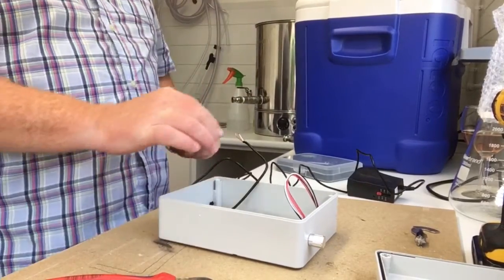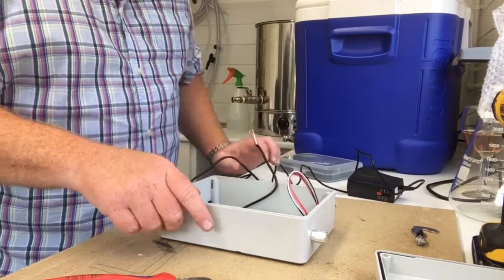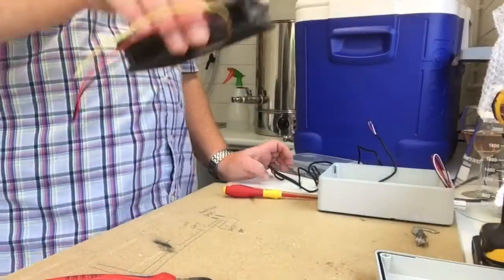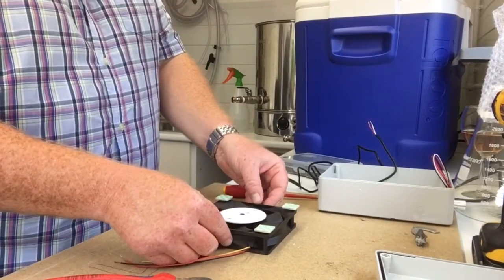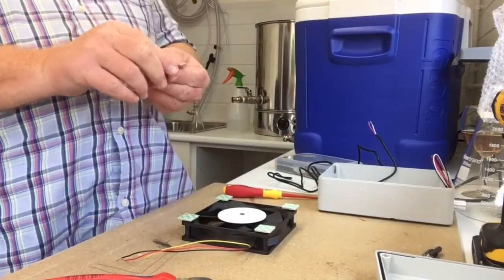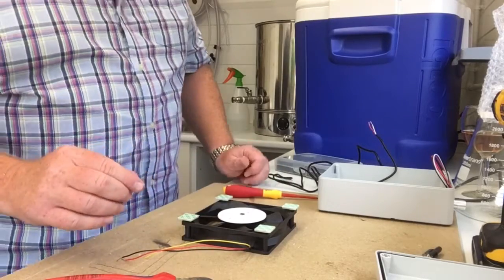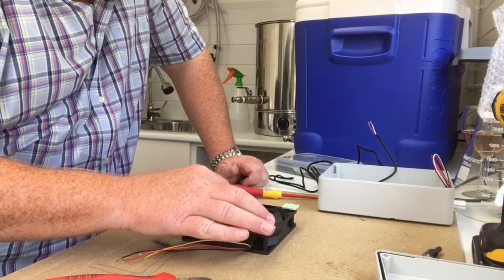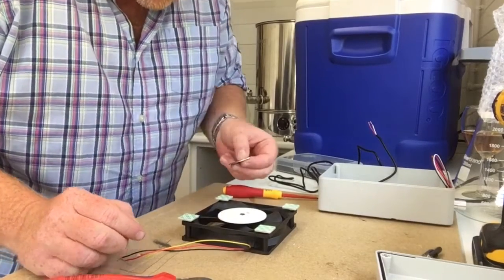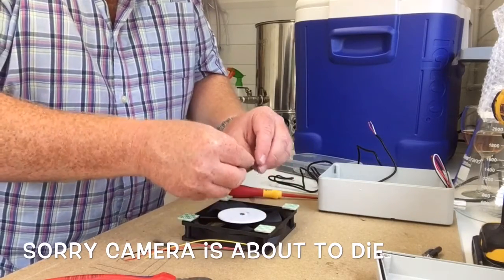Happy days. Going nowhere. Yeah, I'll wait till that sets. So let's finish off what we need to do with the adhesive. And then we're cooking. Wait for it to set, then we'll put it together. Magnets wise, I'm not sure about. Not sure. So off center. So let's go for it.